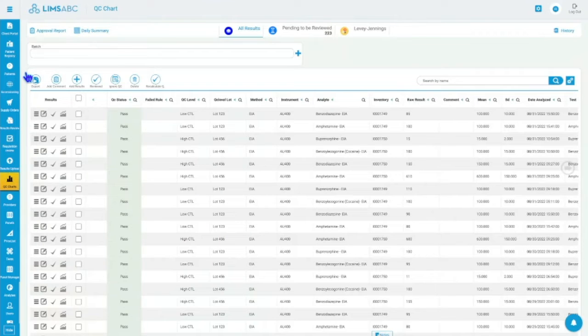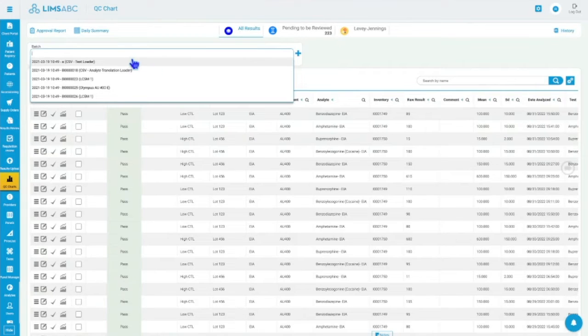But let's assume we get the configuration done, and as these results come in, we're going to process them, and they're going to be first available in this QC charts application in the all results. And this application shows all of the QC results, shows the newest results at the top, right? So you open the application, it brings the results up front. If you run it for, let's say, a UTI or for a tox batch, then you can actually filter by the batch or from the batch review. From results review, you can actually see the results for that batch.